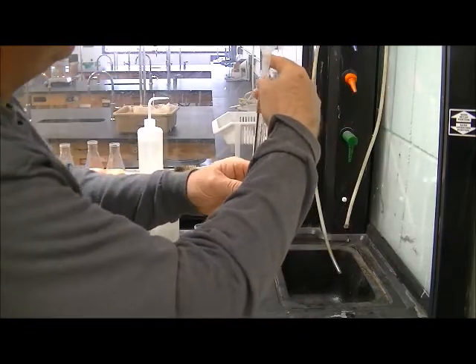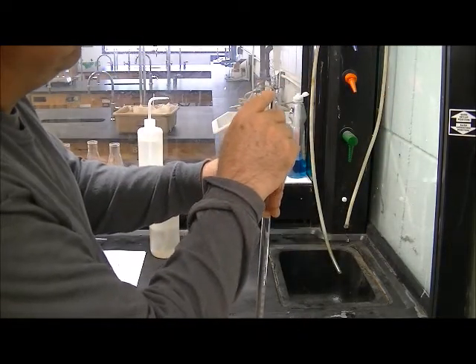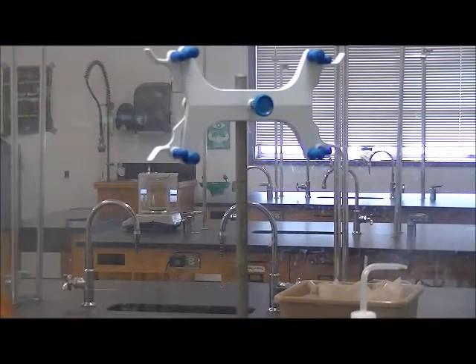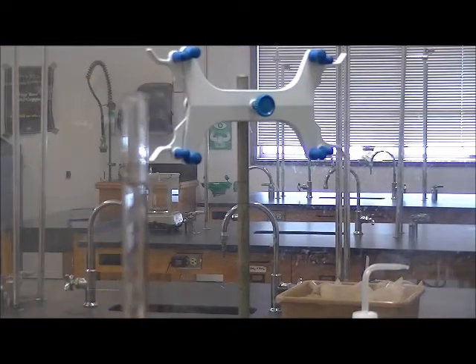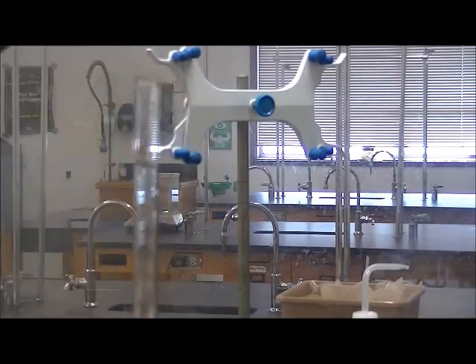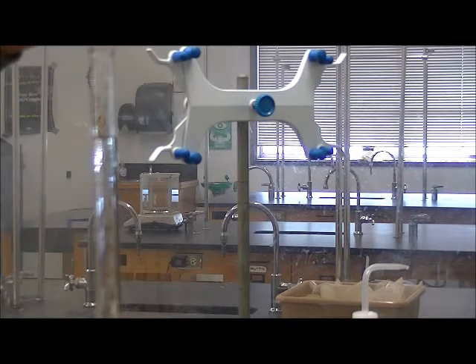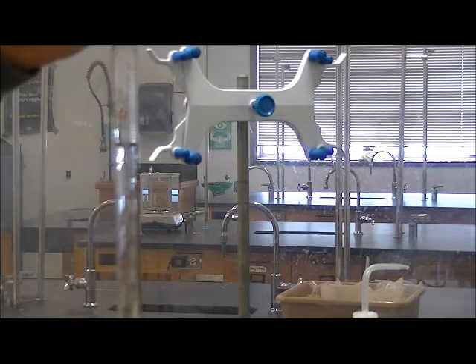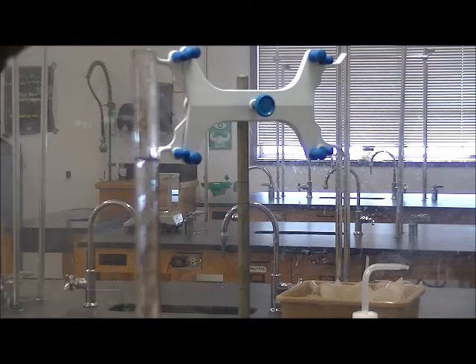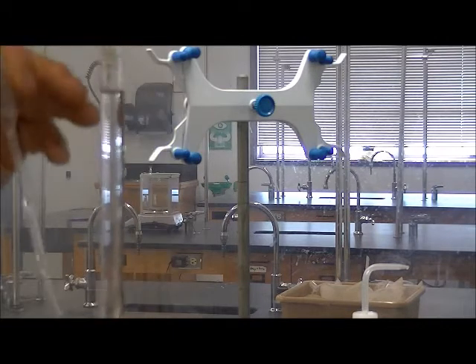So there the burette is filled, here's the zero mark and there's my liquid level. Once I fill my burette above the zero mark I like to use a pipette to adjust that level just until the bottom of the meniscus is at the zero line.